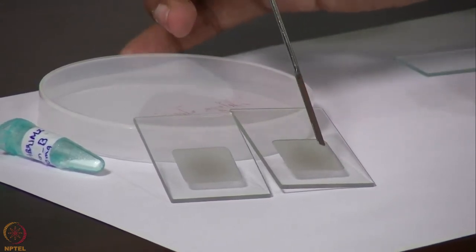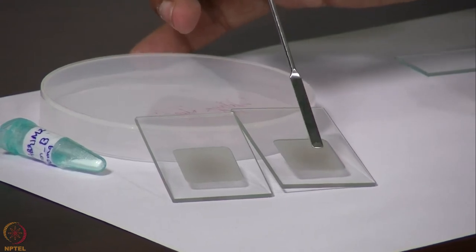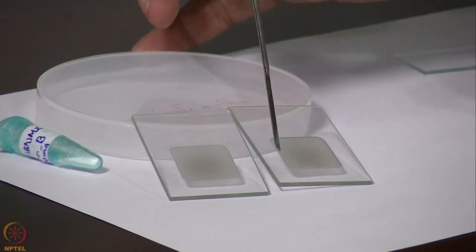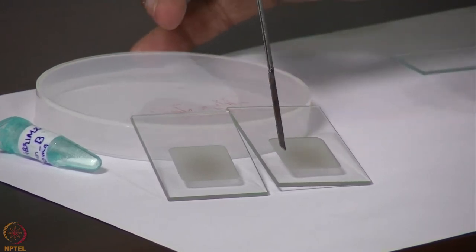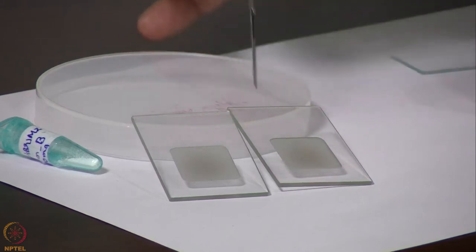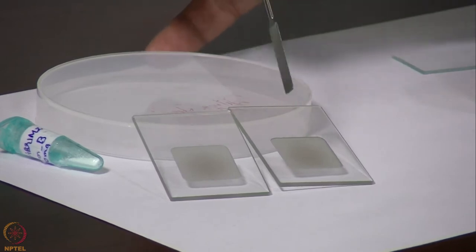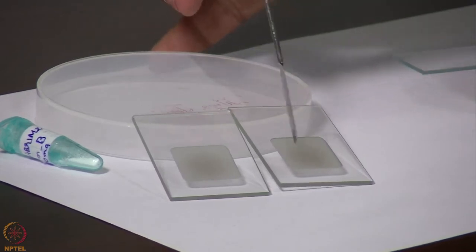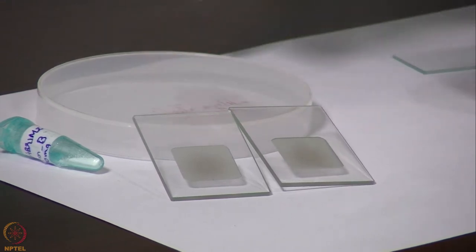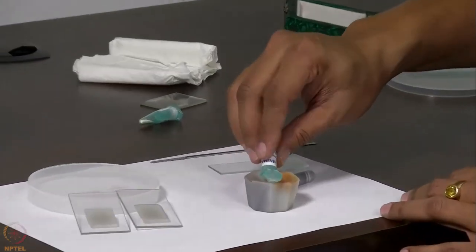These plates come with different depths like 0.1, 0.2 and 0.5 millimeter depth, and the size is about 1.5 centimeter square. Technically one has to fill the entire square with sample, but in case we do not have enough sample, we just fill the central zone of the sample plate and place it on the diffractometer. To make the sample, we transfer the crystallized material.